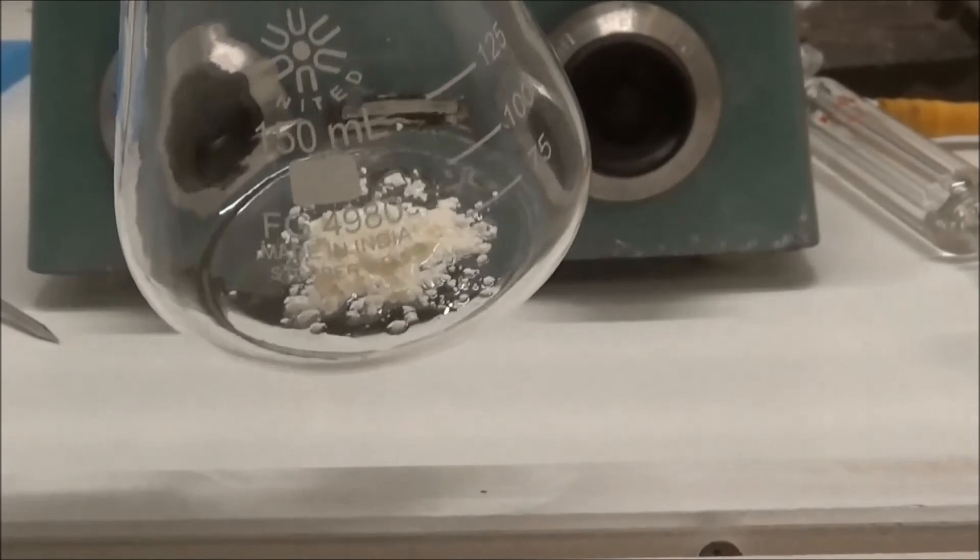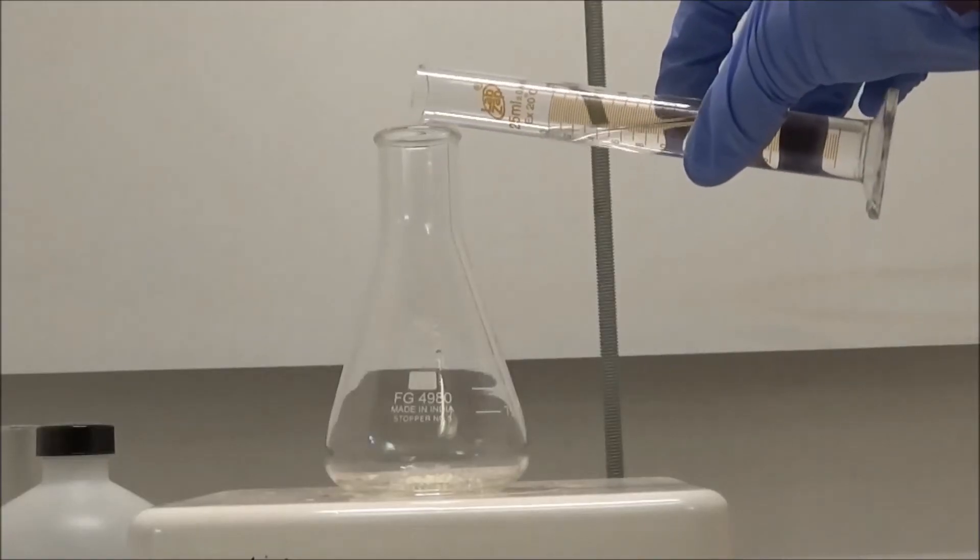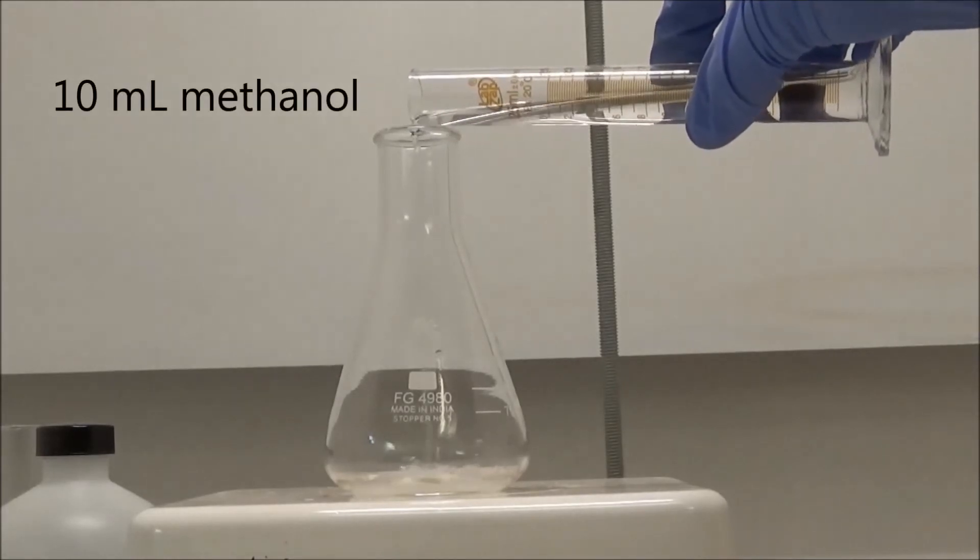To show its chemiluminescence, I added 0.2 grams to a flask. Onto this solid, I poured in 10 milliliters of methanol.